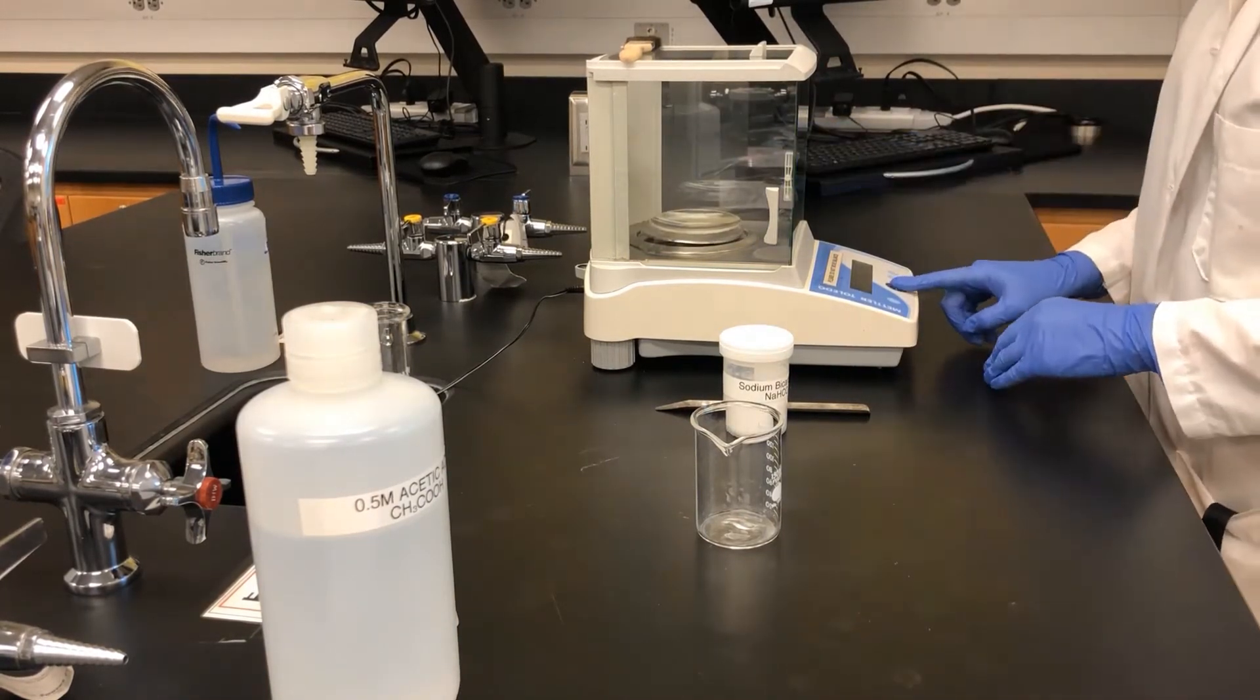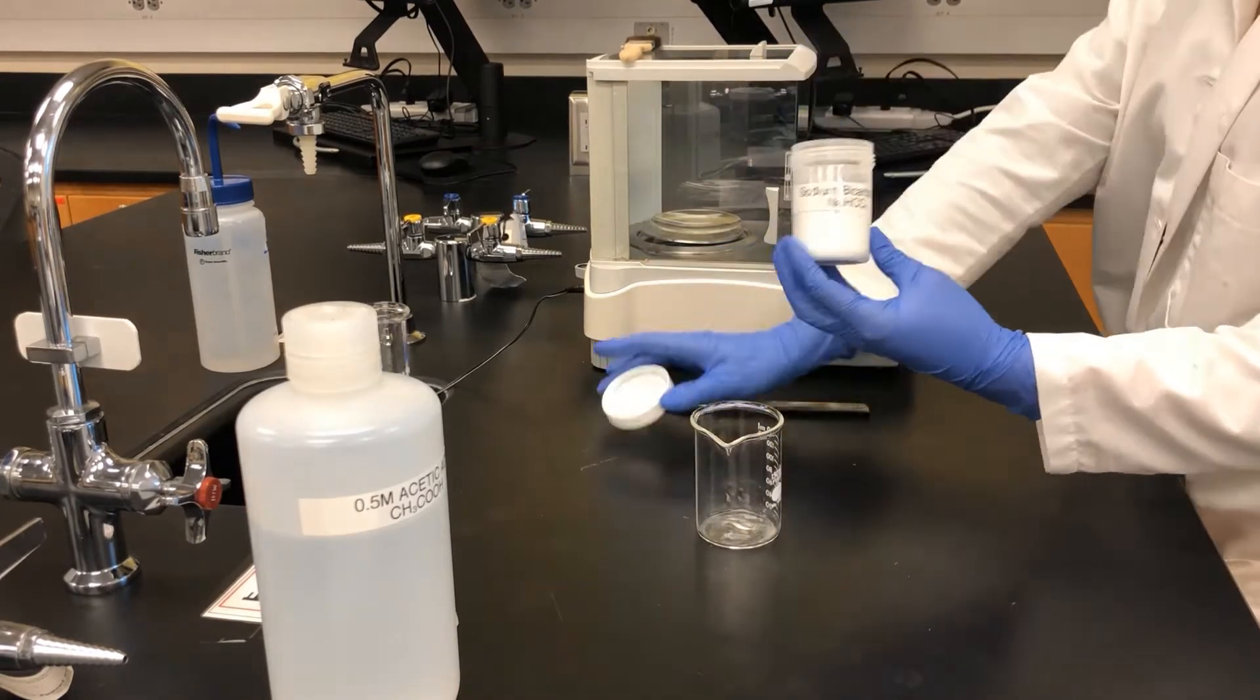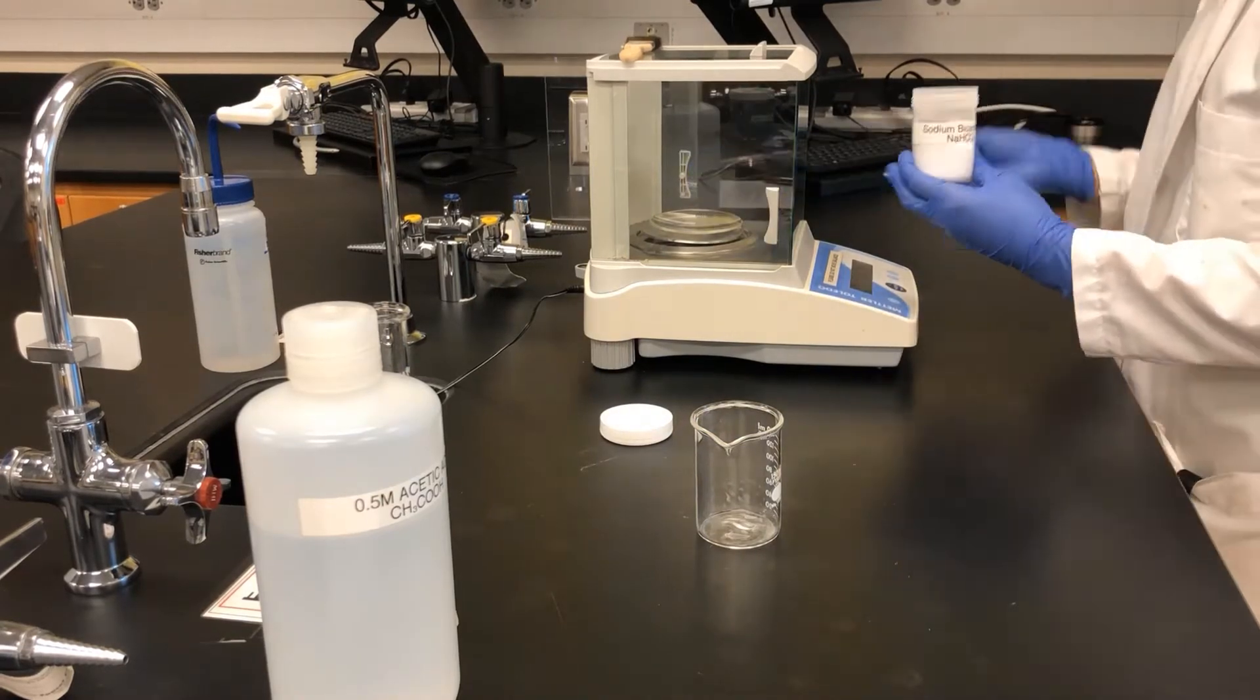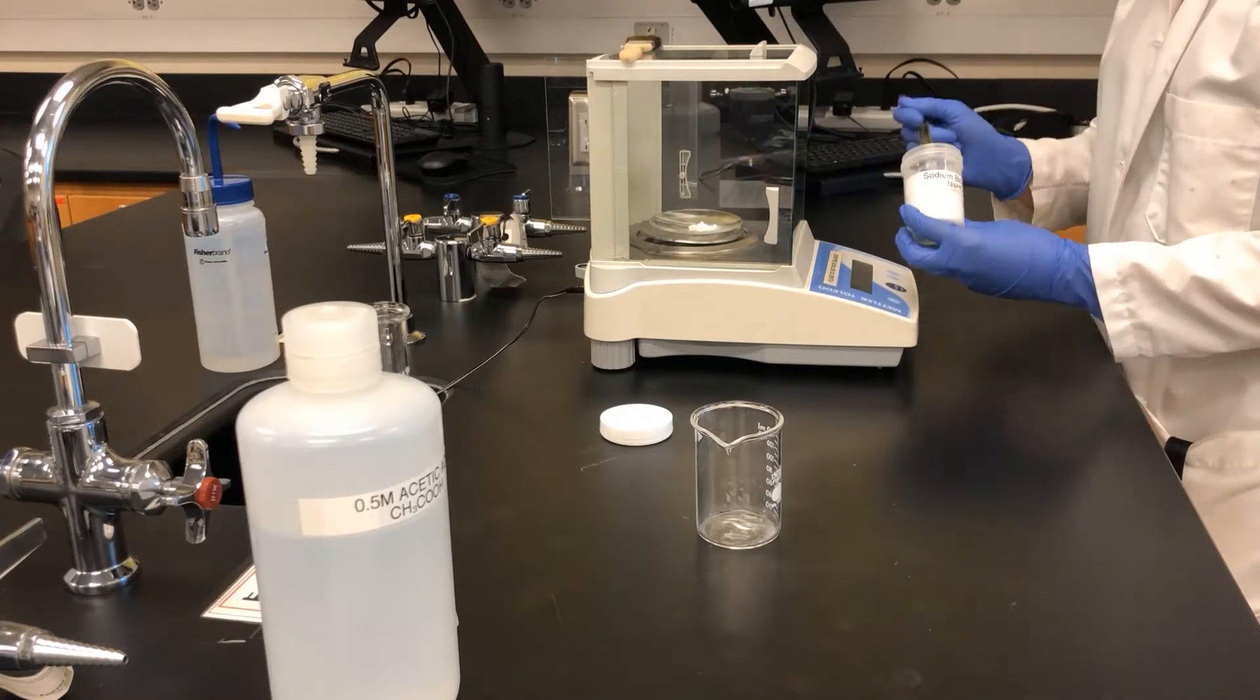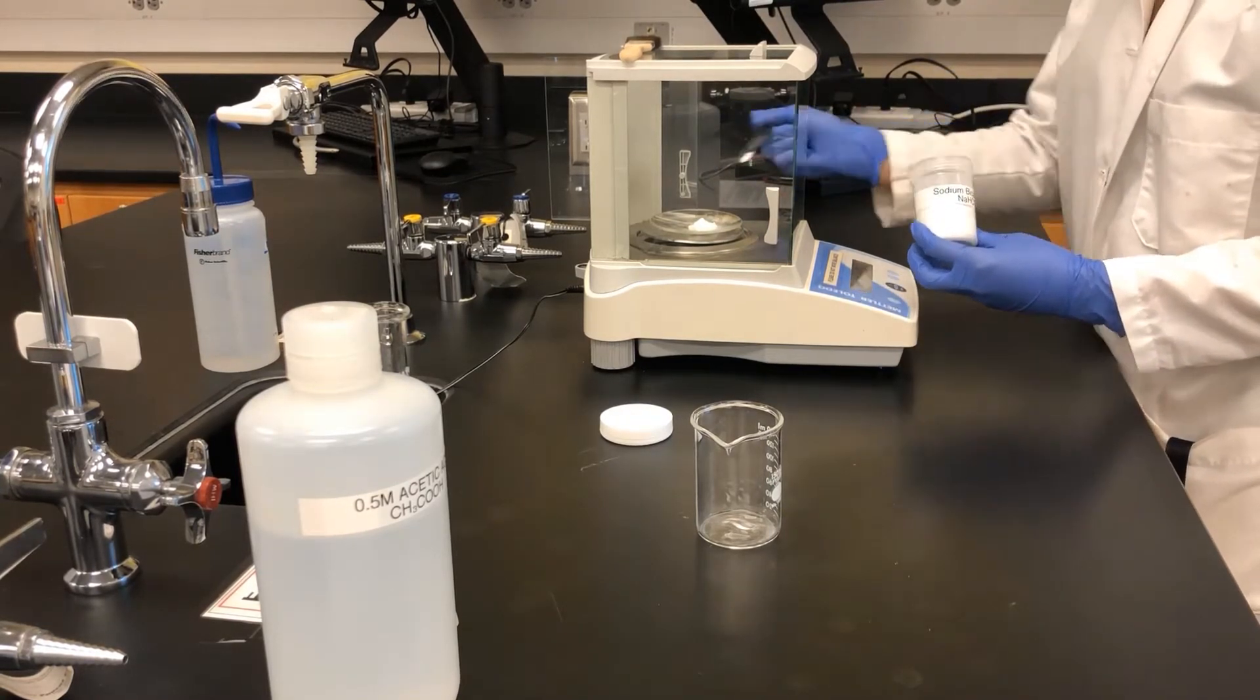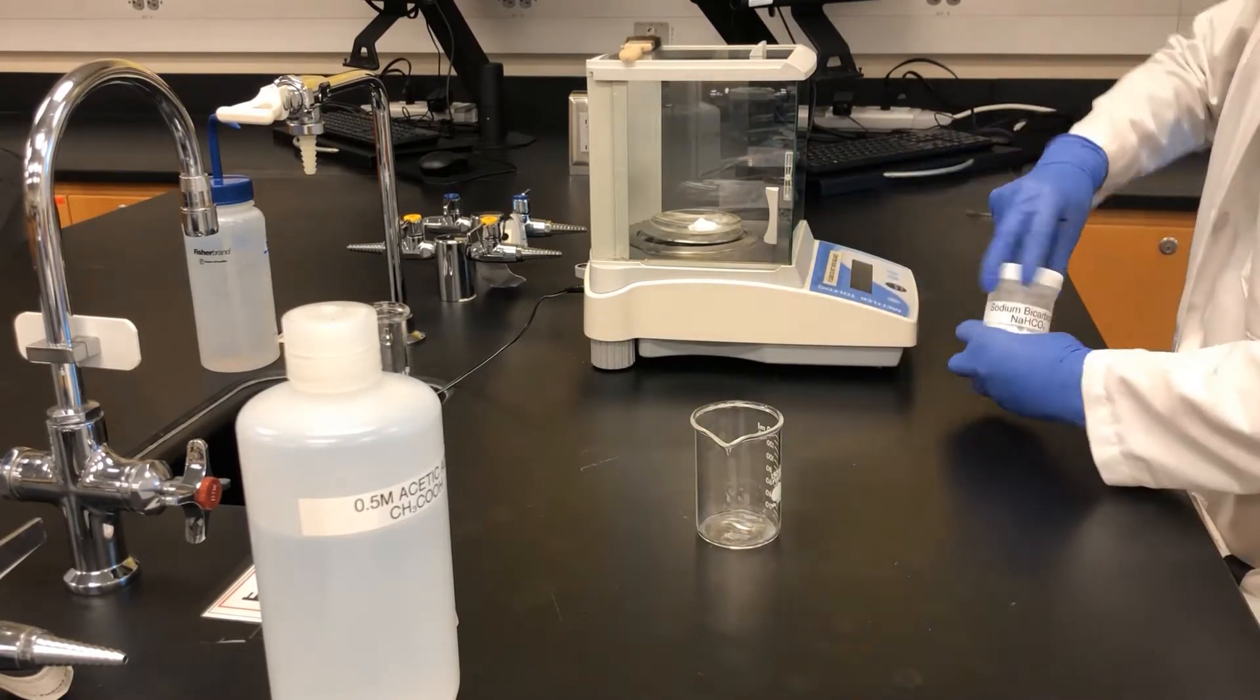First, a watch glass is put on the balance. Then approximately 2 grams of sodium bicarbonate is measured. The exact mass of sodium bicarbonate is measured and recorded.